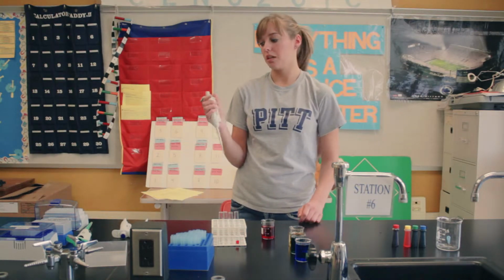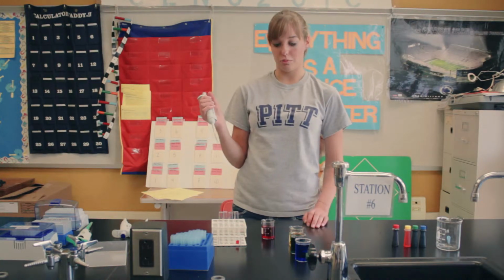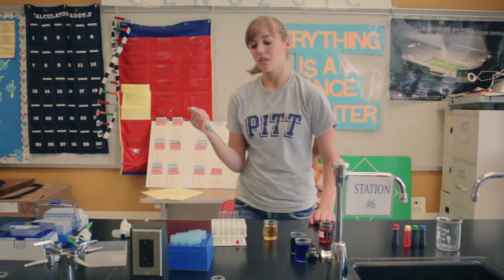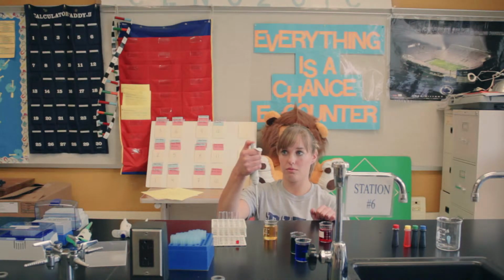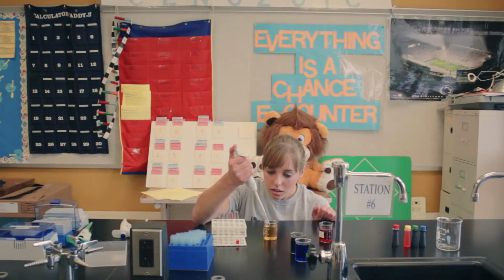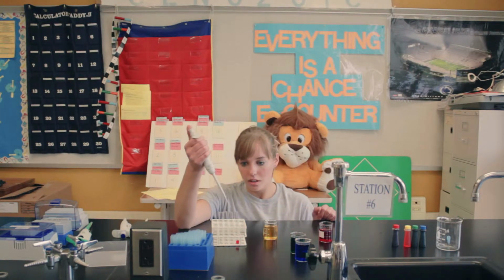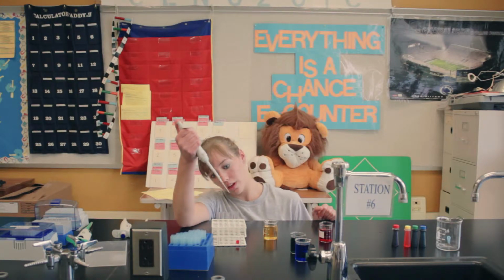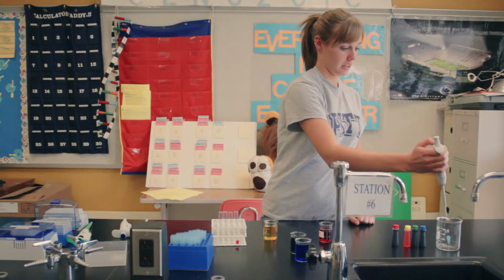For the Eppendorf, make sure you're using the correct tip for whichever one you're using, and those are all labeled too. It's the same idea. You can't go down the whole way. There's the first stop, and then if you push down the whole way, it releases the sample. And then put the tip into the cuvette up against the side and release. And then same idea to release the tip.